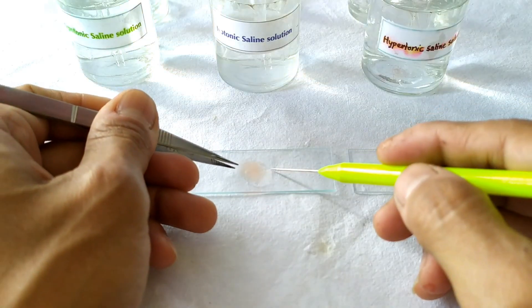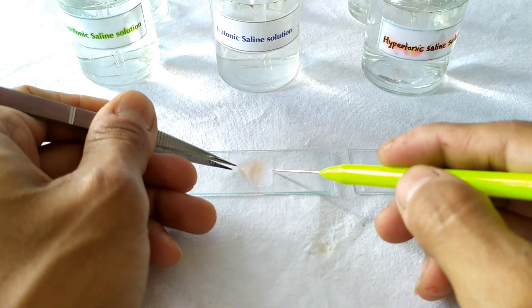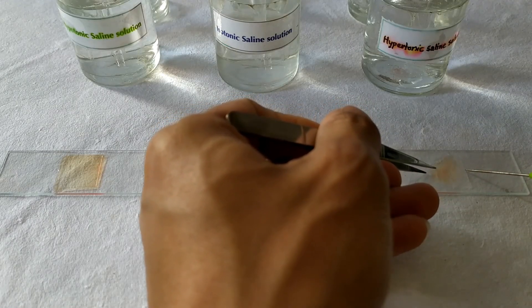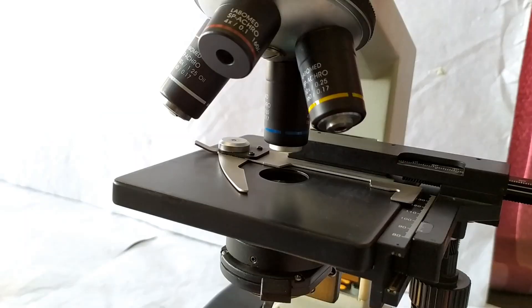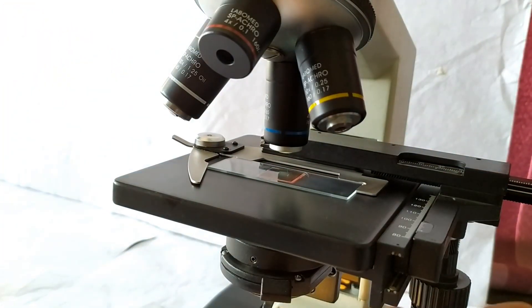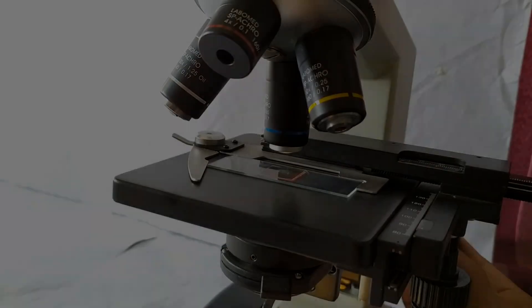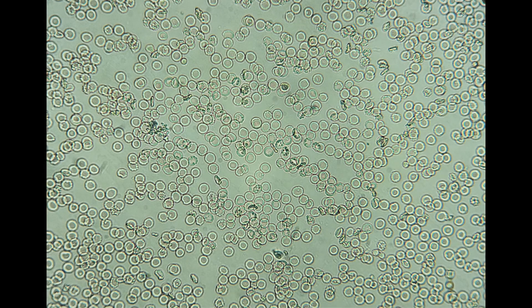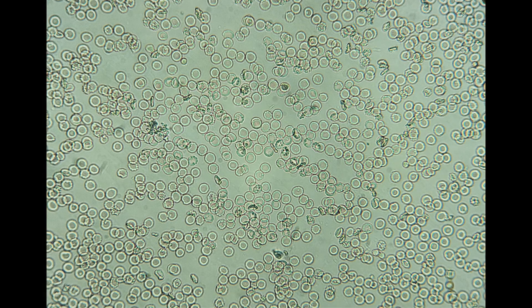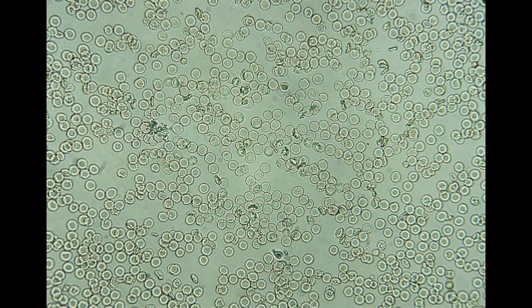Allow the slides to stand for a few minutes. Then observe each slide under the microscope. In the slide containing the isotonic solution, the RBCs do not exhibit significant change in their cell shape or volume — they retain their normal turgidity.